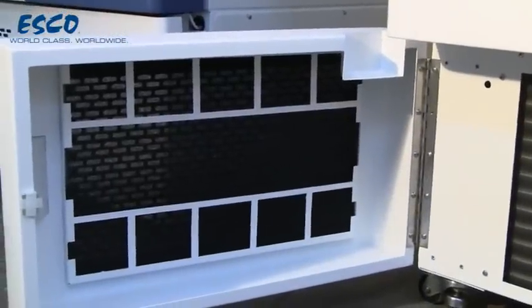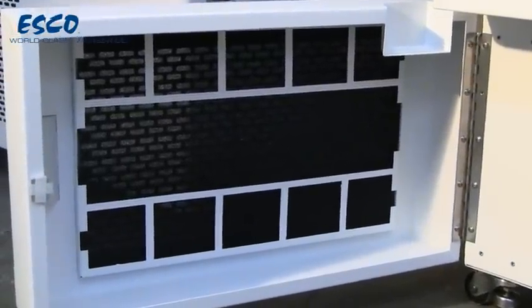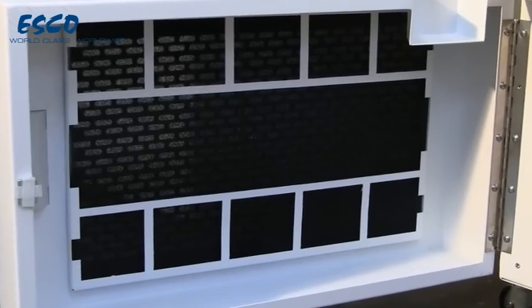The air filters are the first line of defense against dust and dirt that might be pulled into the condenser. It is necessary to inspect and clean the filters on a regular basis.